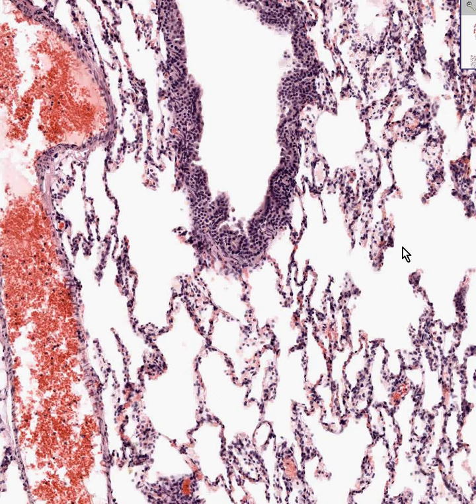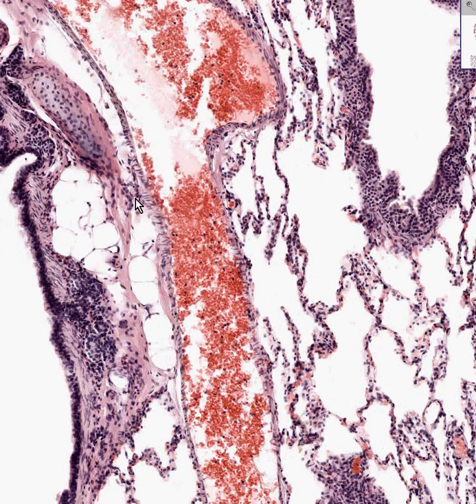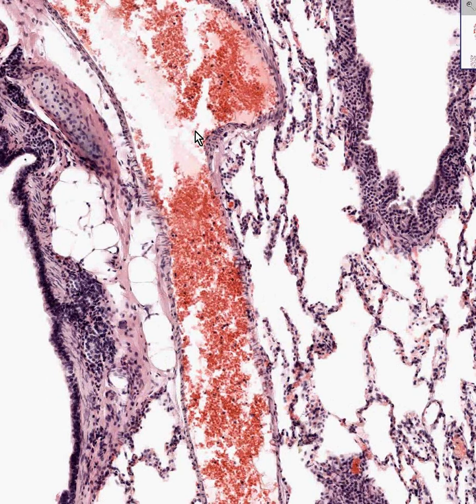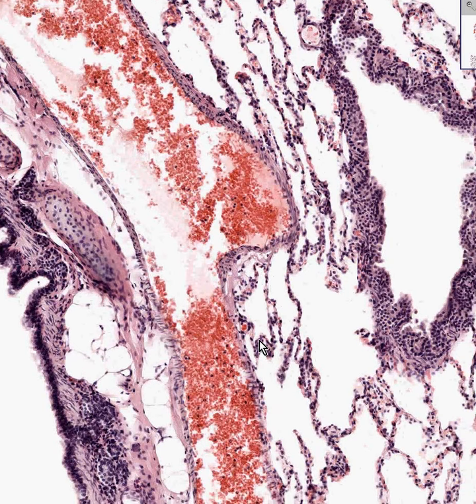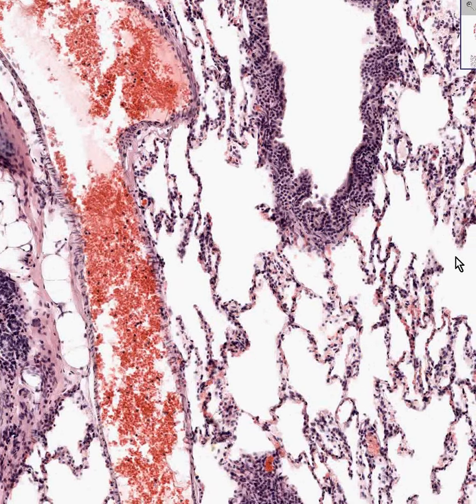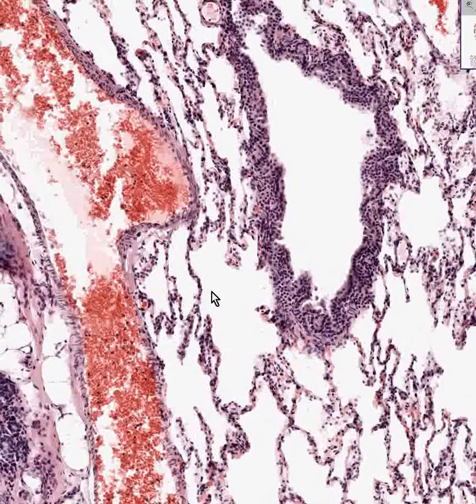The mid-portion between an alveolar duct and a bronchiole is a respiratory bronchiole, which are sometimes hard to find, and I don't think I want to waste my time trying to do it. But remember, it is the respiratory bronchiole in which the normally ciliated columnar epithelium then becomes cuboidal before it actually becomes squamous to involve the alveoli and alveolar ducts. So let's review it.